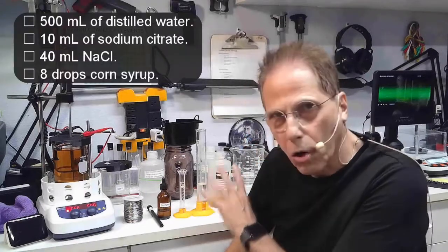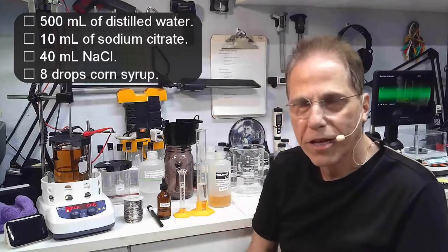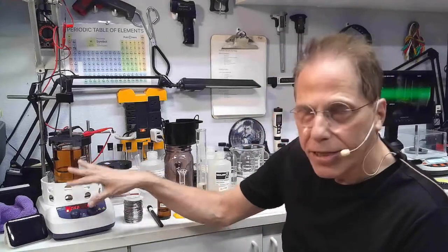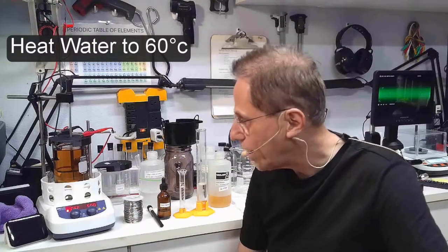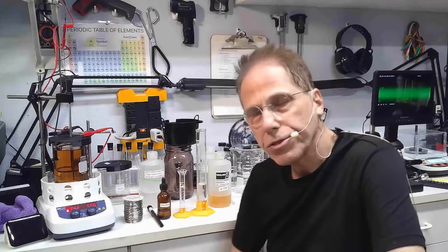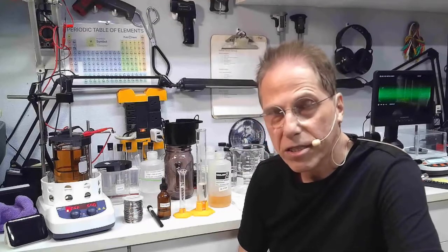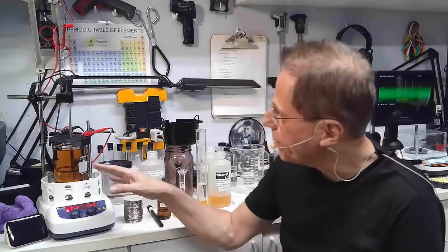It is one of the more complicated things to cook, though. I use the gold formula — the same formula I use to cook gold. So we're going to briefly go through that. The first thing you're going to do is heat the water to 60 degrees C. You don't have to heat it to 60°C if you don't want to — I did it because I wanted to go faster. The first batch I cooked took two hours without heat, so I raised it to 60°C and it cooked in 20 minutes.